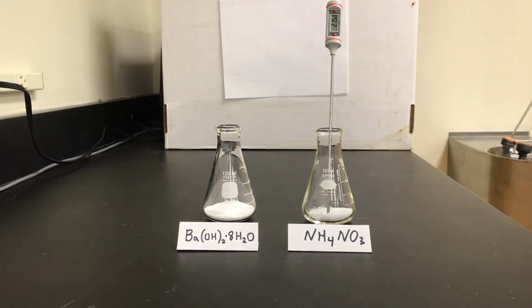Now, before we start the reaction, let's talk about this, because you might notice that I have my two reactants here in the solid state. This is a kind of unusual reaction in that it is a reaction between ionic compounds that will actually initiate in the solid state, unlike a lot of the precipitation reactions that we've talked about in class before. So we're going to mix these two solids, and then we're going to see what the effect on the temperature is from this endothermic process.